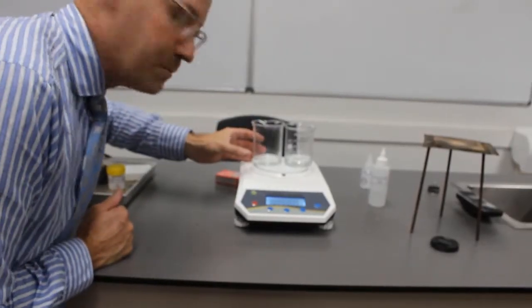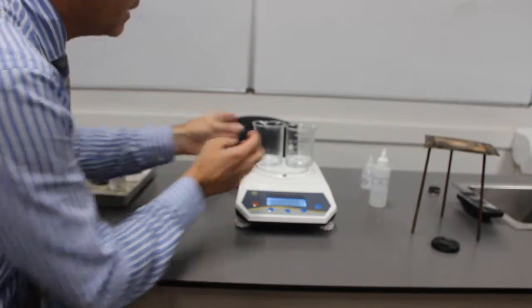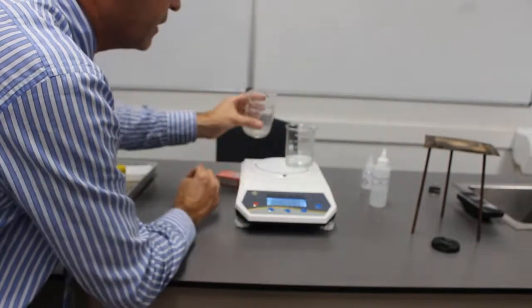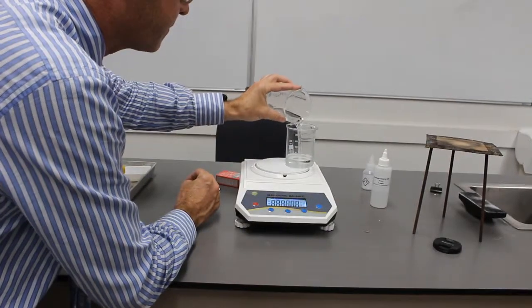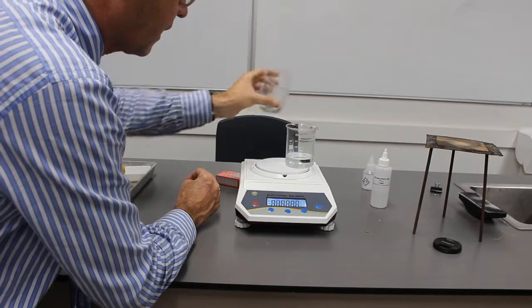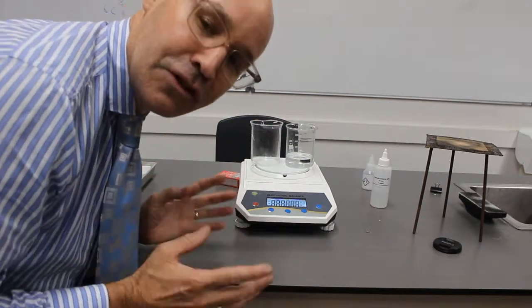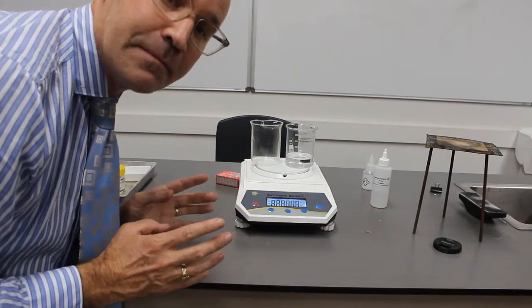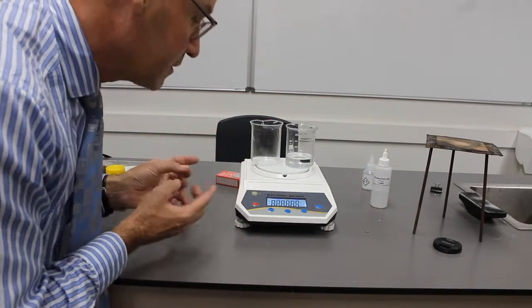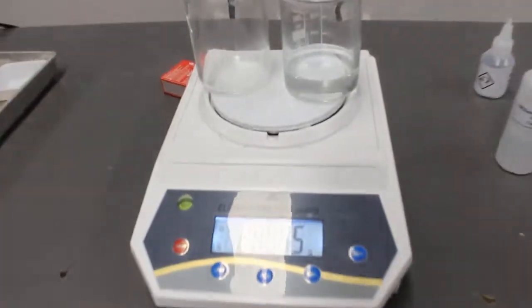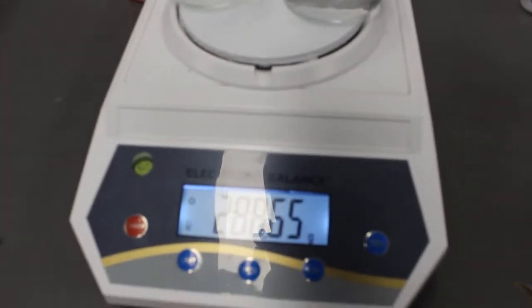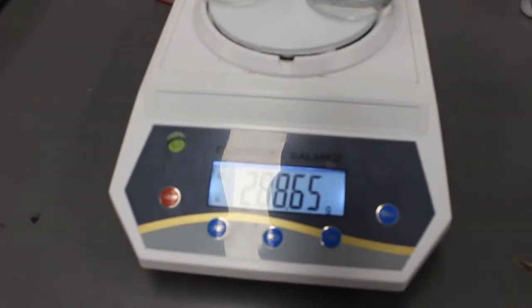So now we're going to mix them. We're going to cause a chemical reaction between the acid and the base. So this first experiment is not very exciting. You don't see much happening. Let's have a look at the mass. The final mass 288.65.